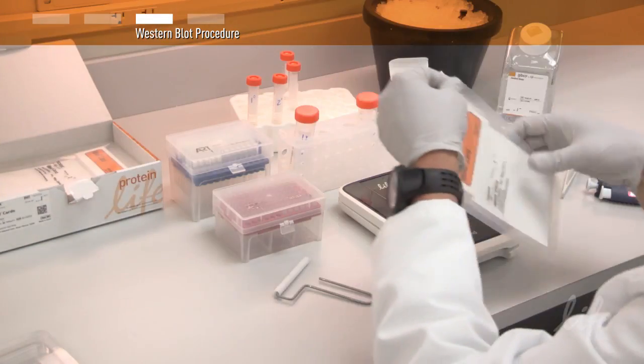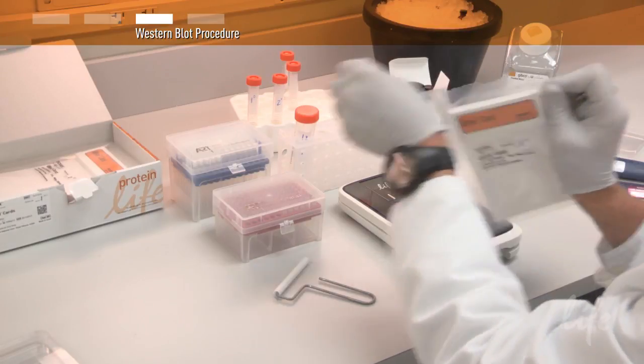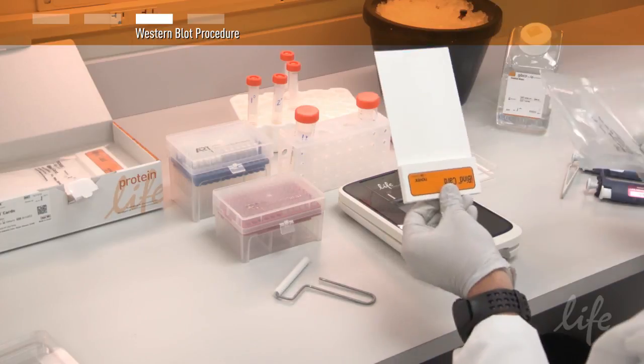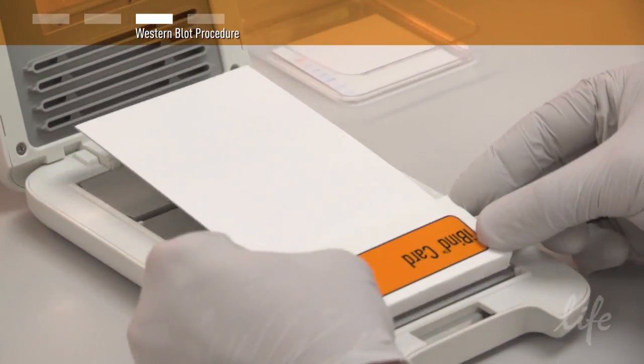Remove the iBind card from the plastic pouch, being careful to only handle it by the absorbent stack. Then place it in the iBind device.